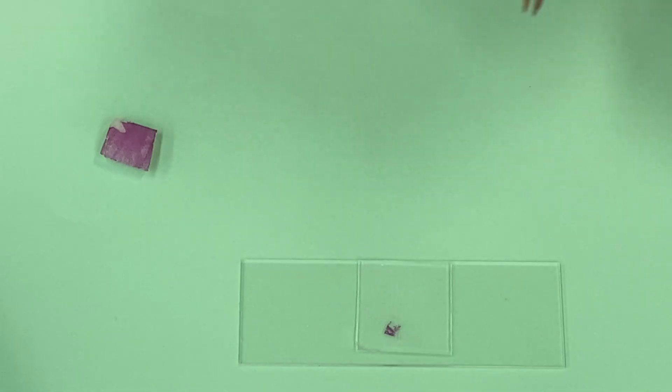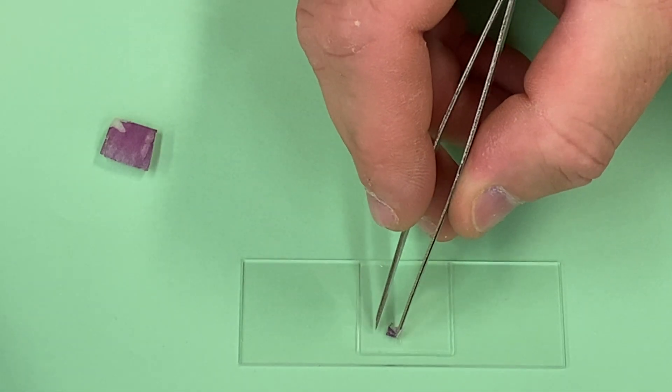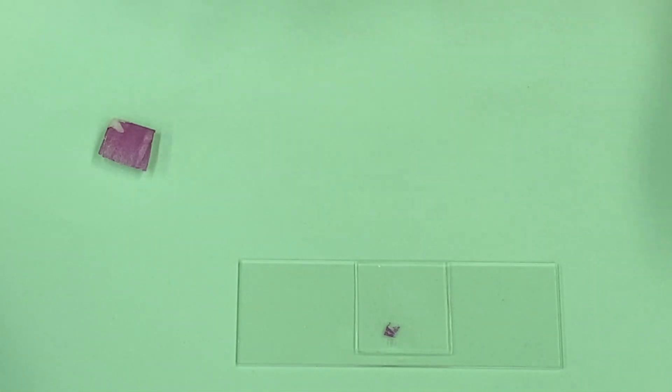Okay, what I'm going to try to do is put it on the microscope and show you what it looks like under the microscope.